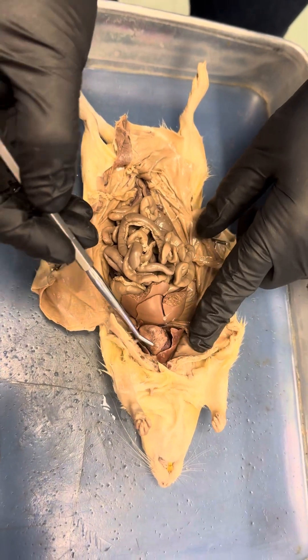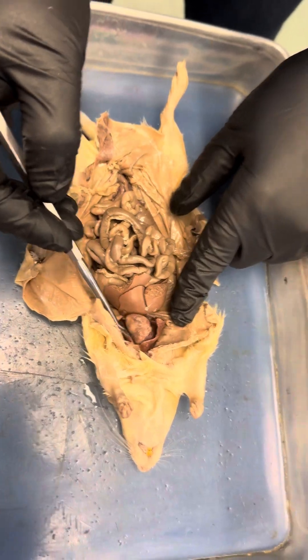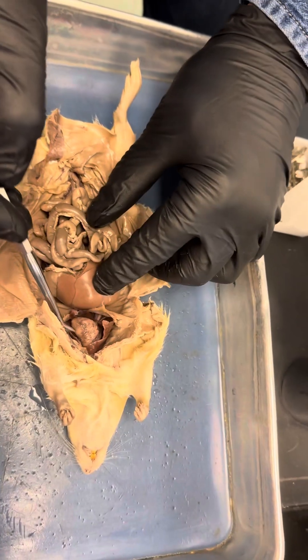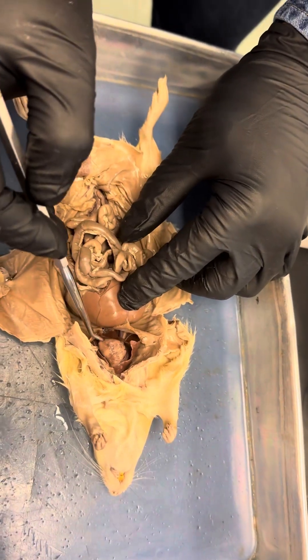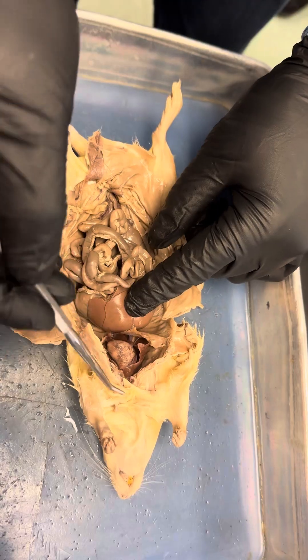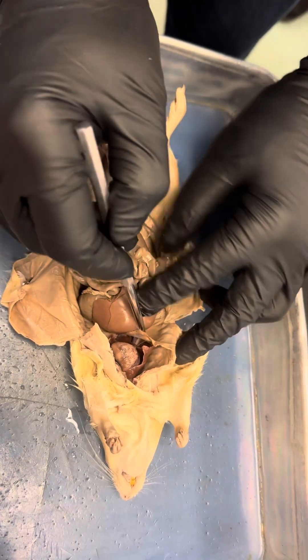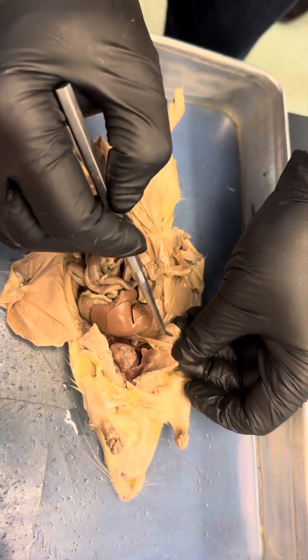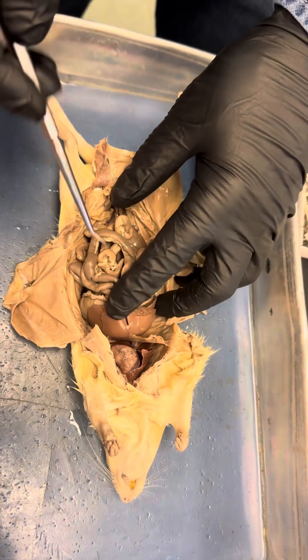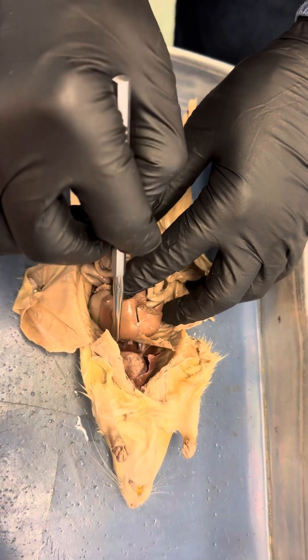Here you have lungs, you have a heart. In between the abdominal cavity and thoracic cavity, this structure right here is called the diaphragm. This diaphragm is the main muscle of respiration.